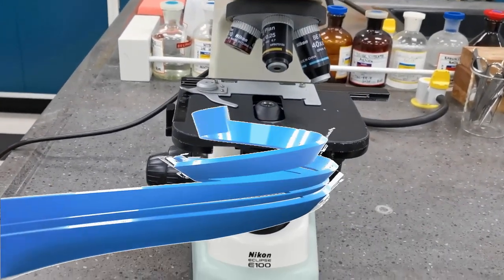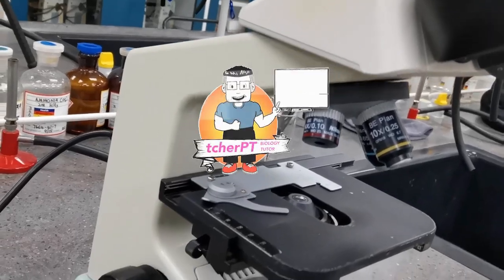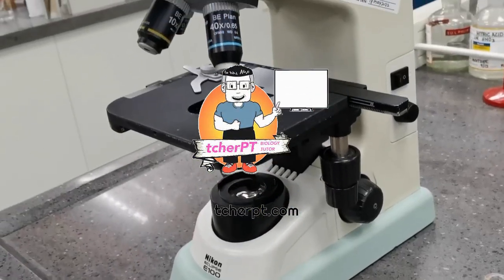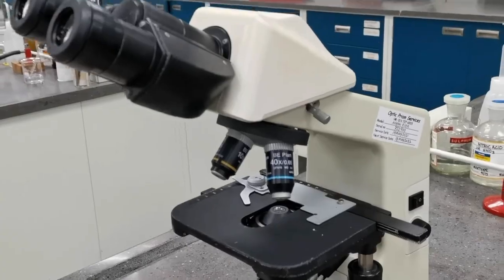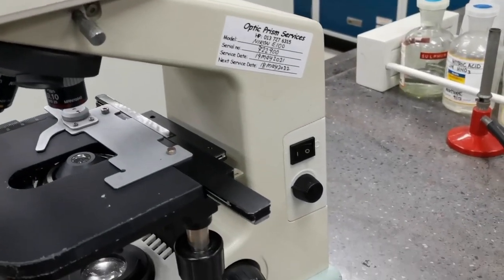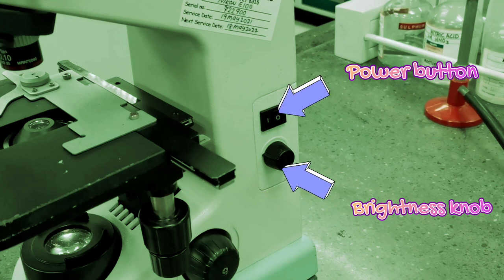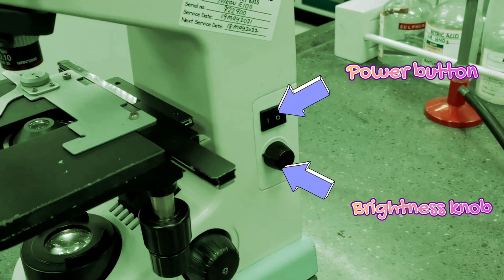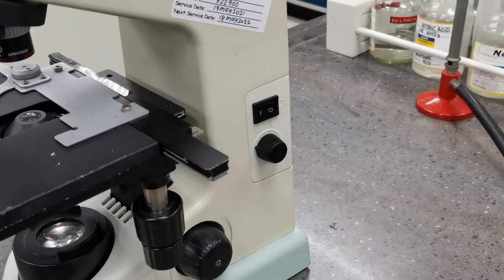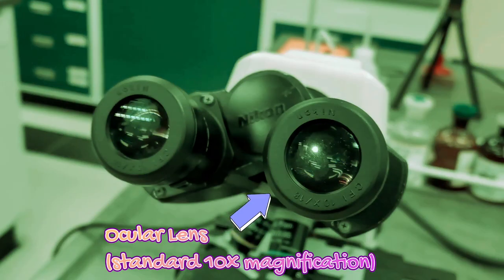In this lesson we will look into the parts of a microscope and their individual roles and functions. First, what you're looking at right here is the power button and the brightness knob. You can use the brightness knob to control the level of brightness coming from the light source.